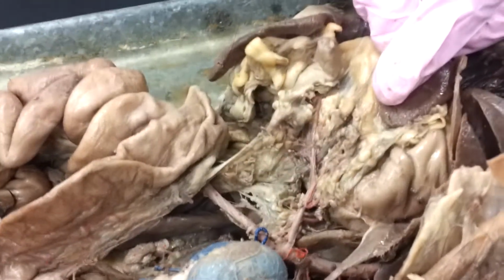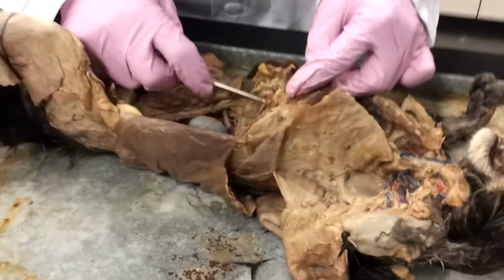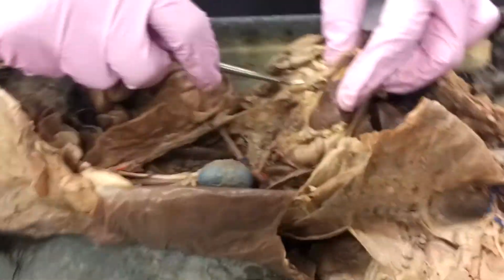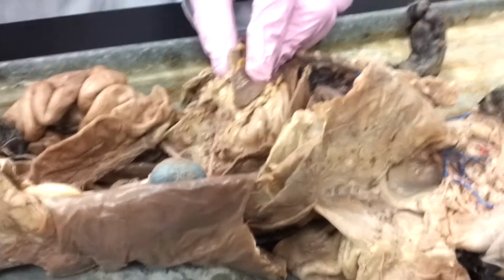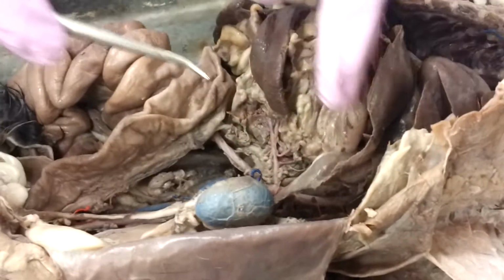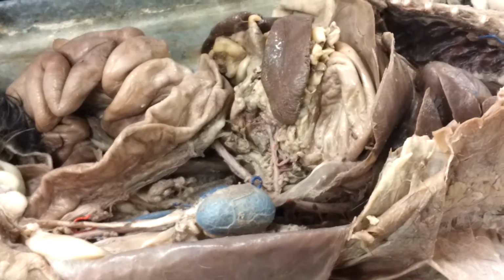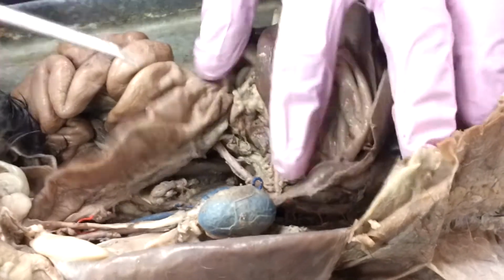So the best way when you get into those organs is doing what's called the pull test. Keep pulling on that artery until you actually get something moving. And in this case, we've got the spleen. So, back to where we are. First branch is the celiac trunk. We've got our hepatic artery, which is going to run all the way through the liver. Then we've got our splenic, and then we've got our gastric. Gastric being stomach, splenic being spleen.